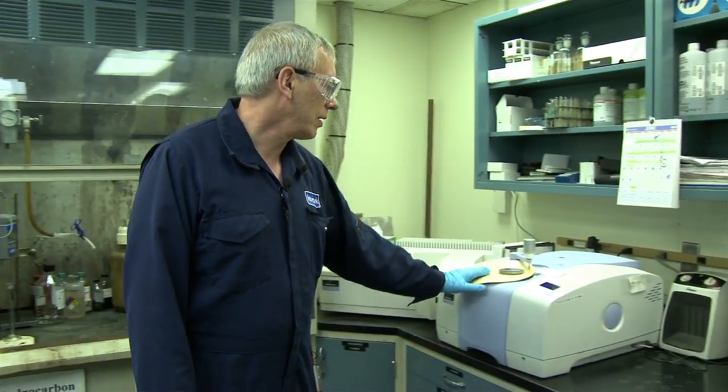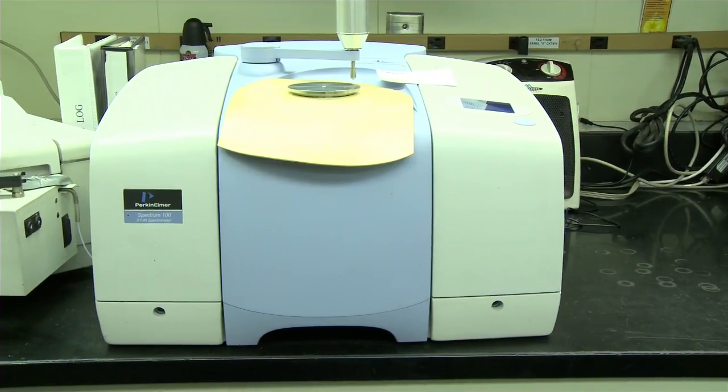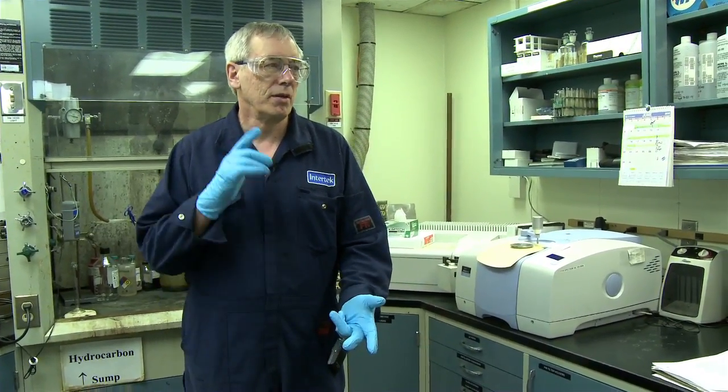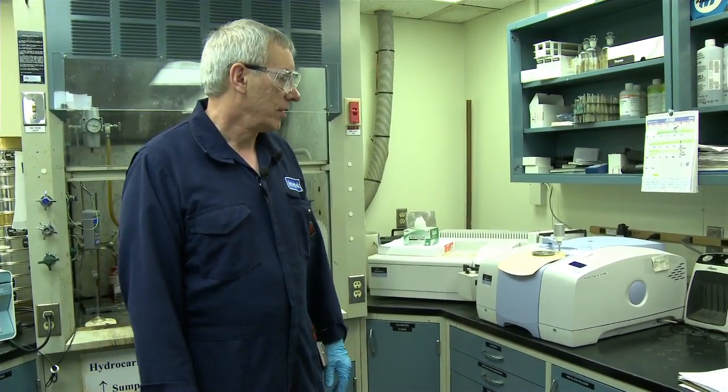This over here is our FTIR. It will give a fingerprint of compounds in the oil field, so that we're able to let the people know if it's anything from methanol or toluene or bulk chemicals. That'll give us a good indication of what's there.